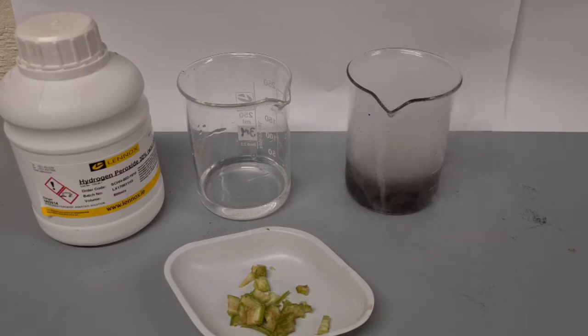When the reaction is over the manganese dioxide, the black powder, will remain behind in the beaker unused.